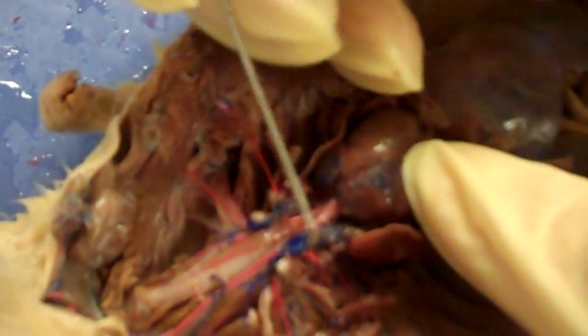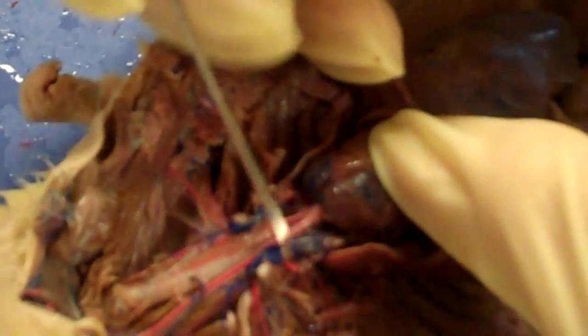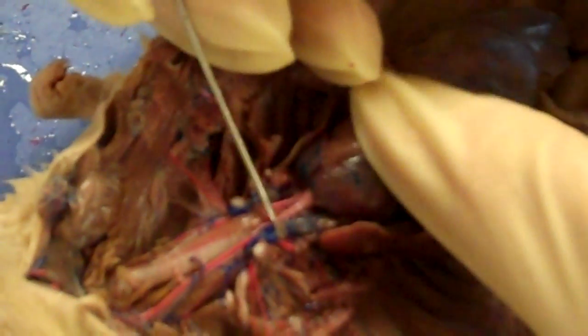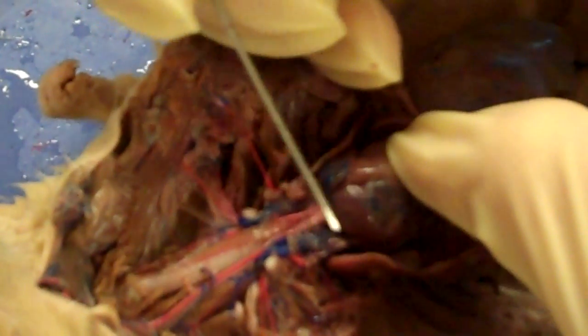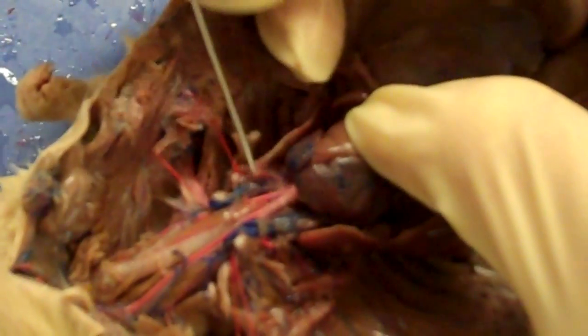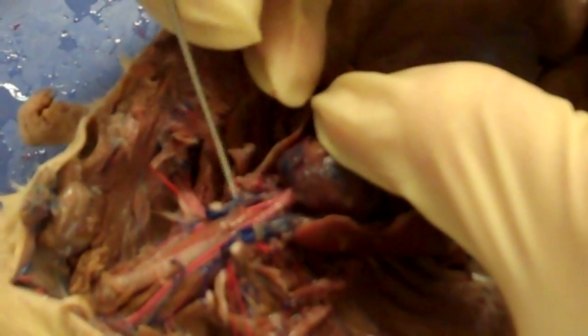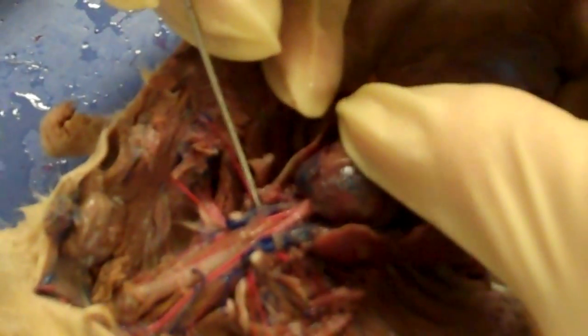These blue ones return the deoxygenated blood to the heart from the head, neck, and shoulders. This would be the right cranial vena cava, and this one here is the left cranial vena cava.